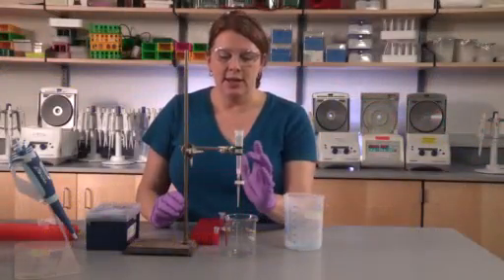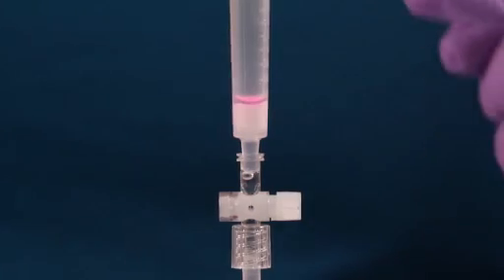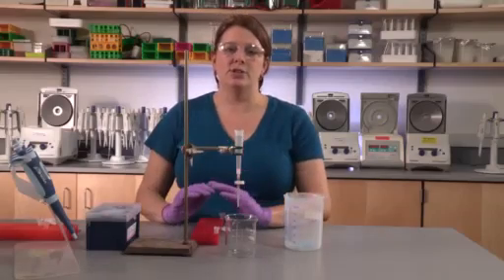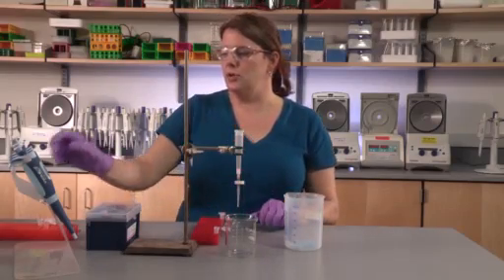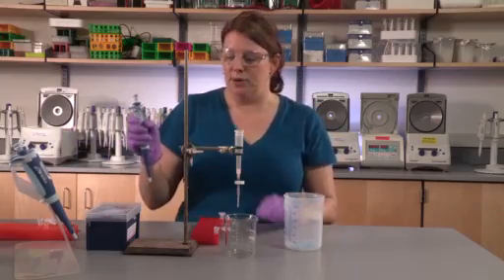The red fluorescent protein has been bound to the chromatography column, and now we wish to elute it. To do so, we'll be applying 2 mL of elution buffer.